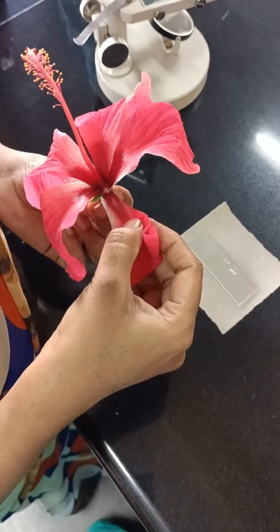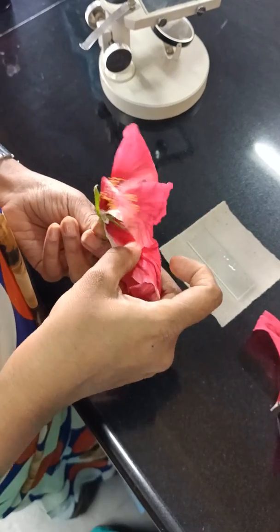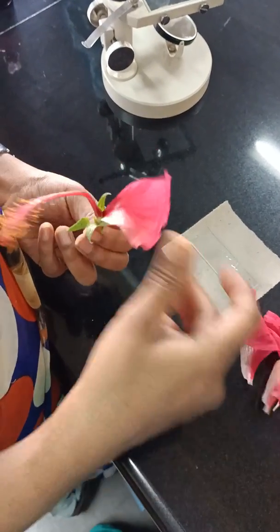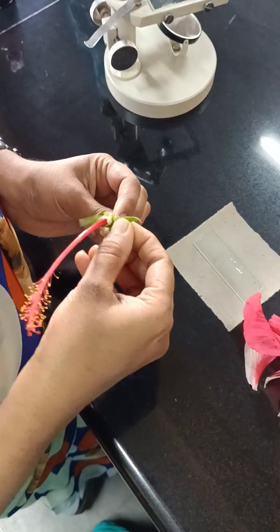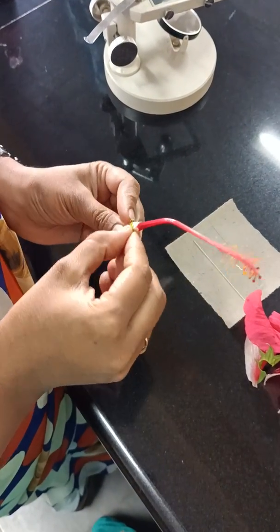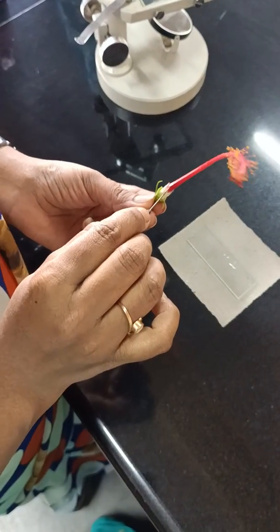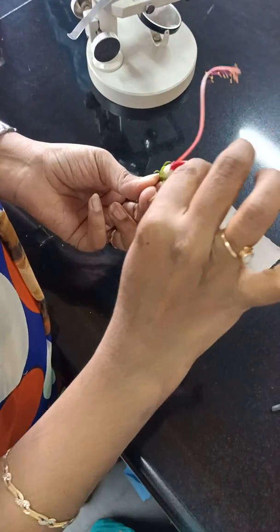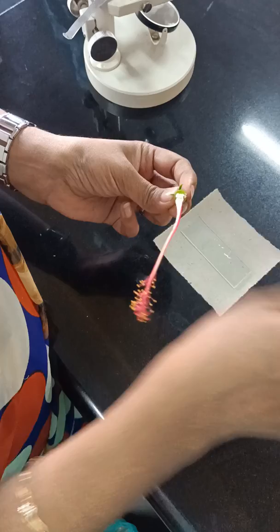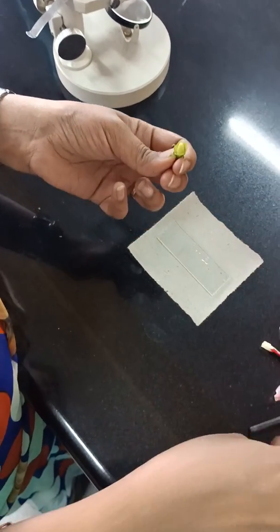First you need to remove the different whorls of the flower. Now I am removing the petals, the corolla portion, and also the calyx — removing the sepals as well. Then we need to trace the stigma, style and ovary. We are not interested in those; we just want the ovary portion. I hope now you could see the ovary.